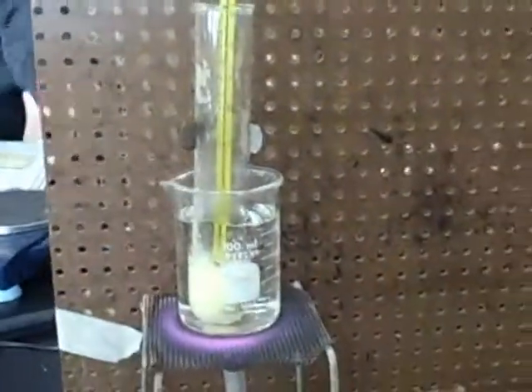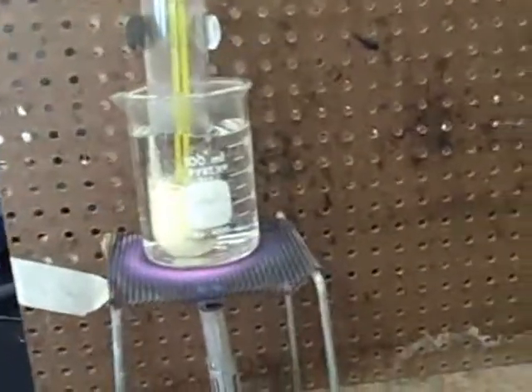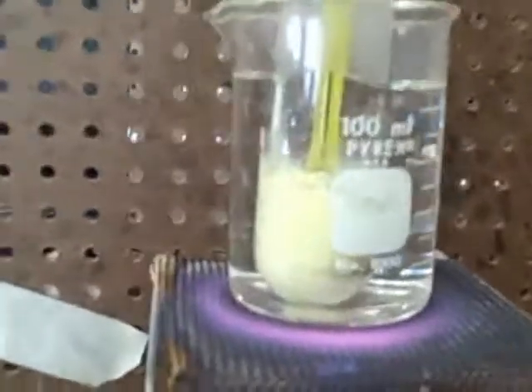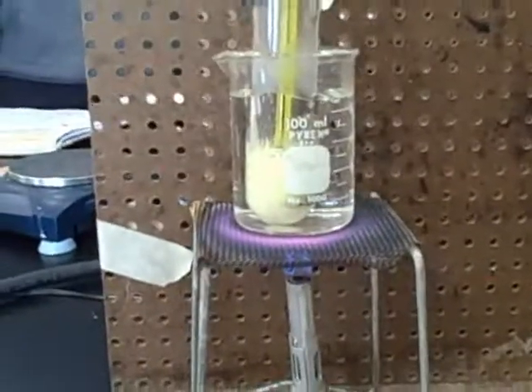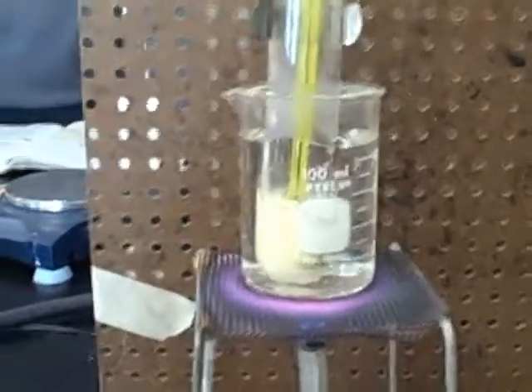What we're doing so far is that we had turned the burner on wearing safety goggles, and we are melting a substance that we do not know. It is yellowish, and I think it's like ice cream. I don't know. Looks like it. Anyways, we are waiting for the substance to melt, and we have no idea what to do right now.